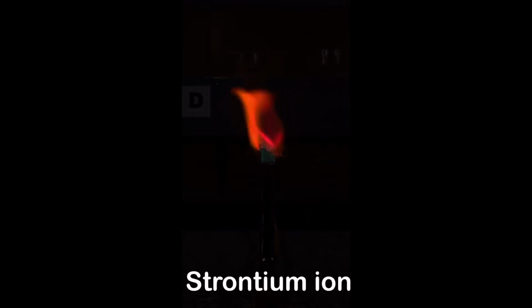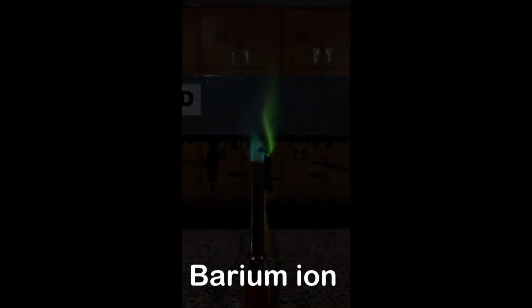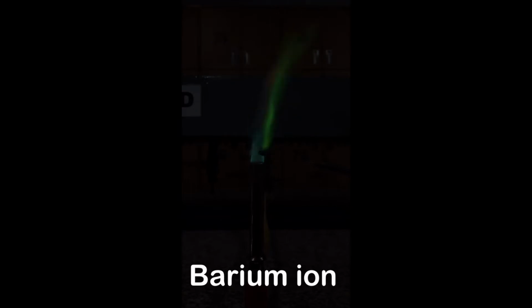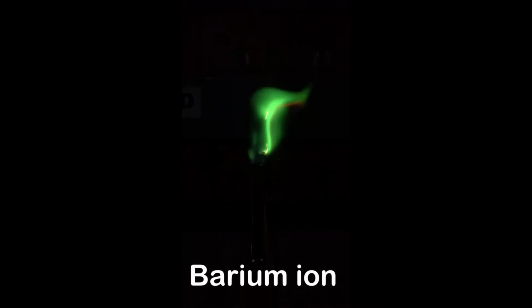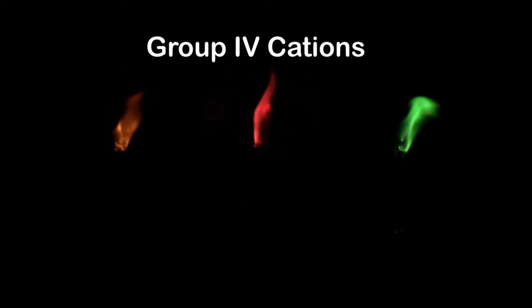Experience is required in identifying the flame of calcium ion and strontium ion as they're almost identical to each other. And lastly, we have the barium ion. So here once again are the group 4 cations.